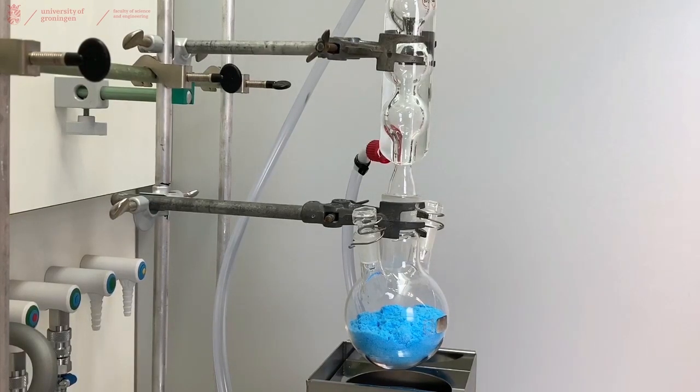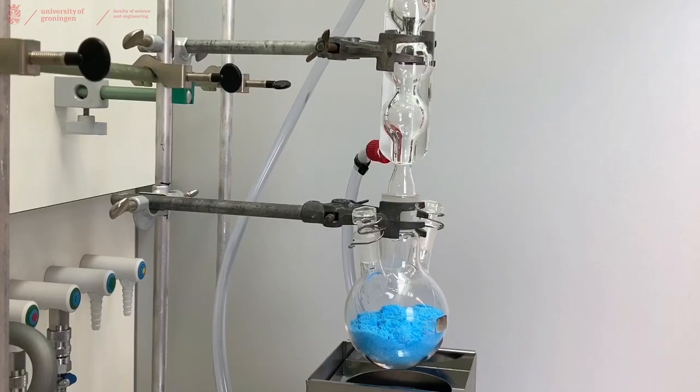In this case we're using quite a small flask for the amount of solid we're having for demonstration purposes. If you would do this same experiment in real life, I would strongly suggest using a bigger flask if you have this amount of solid.